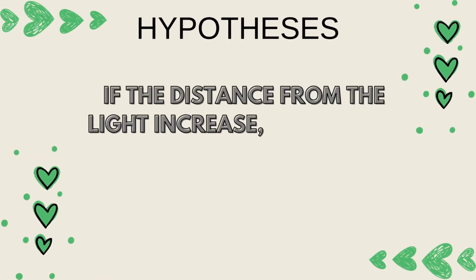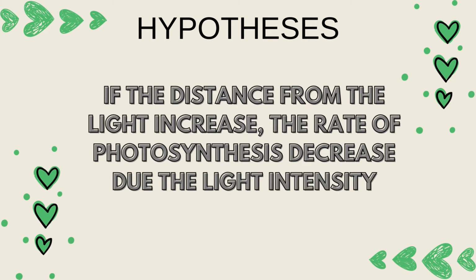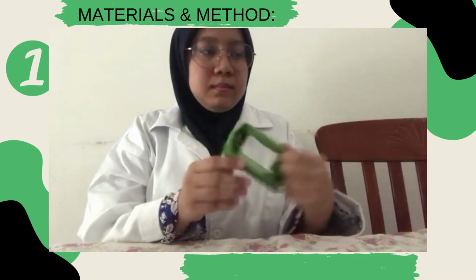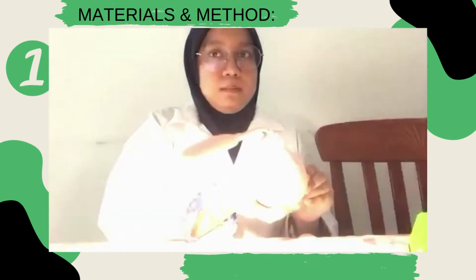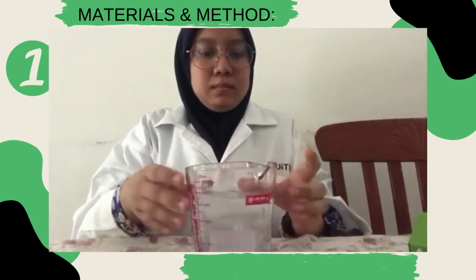Hypothesis: if the distance from the light increases, the rate of photosynthesis decreases due to the light intensity. Materials: first, I chose bougainvillea leaves, syringe, hole punch, measuring tape, light, beaker of 500 ml to 1000 ml filled with water, baking soda, glass, and a timer.